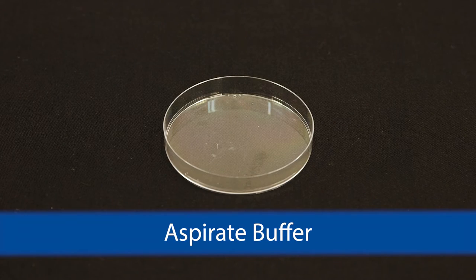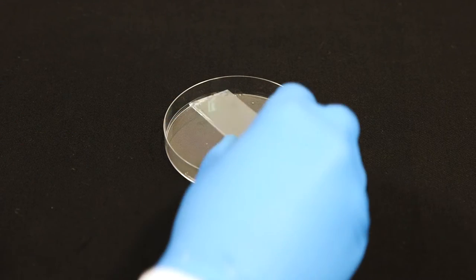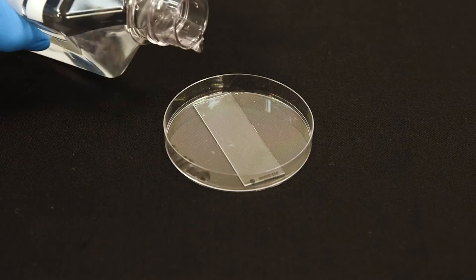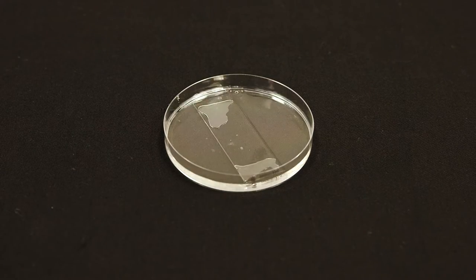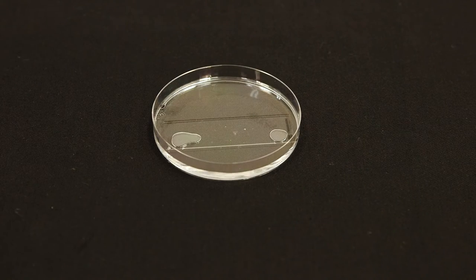SC-West chips need to be hydrated prior to use. Remove an SC-West chip from its canister and place in a clean Petri dish, gel side up. Add 15 milliliters of suspension buffer to the dish and let the chip rehydrate for at least 10 minutes.